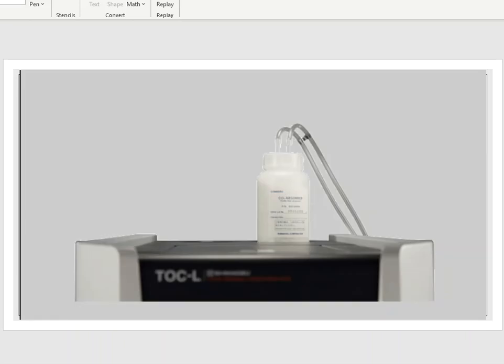So this TOC instrument normally has the CO2 absorber at the very top. And this is what you're seeing in the picture. You can see the label on the front. The label on the front says CO2 absorber, and there are two lines that basically come into the CO2 absorber. These are lines, of course, that are leading out from the NDIR detector, because everything flows through and out, and then the sample goes into the CO2 absorber.